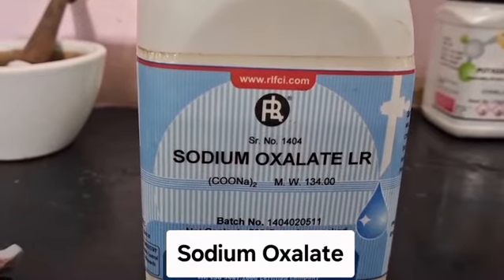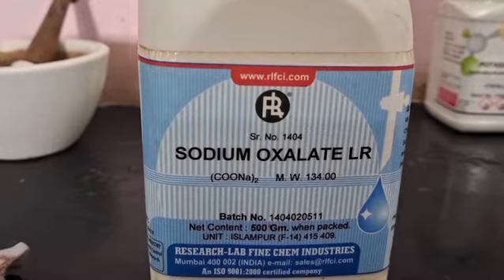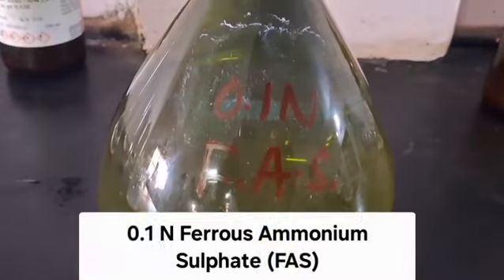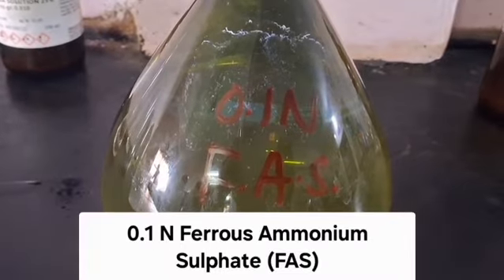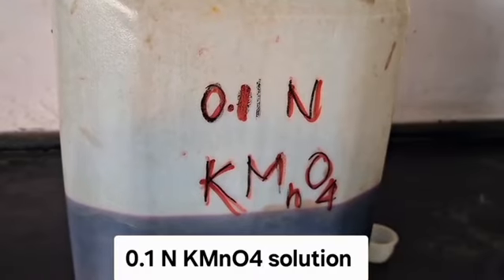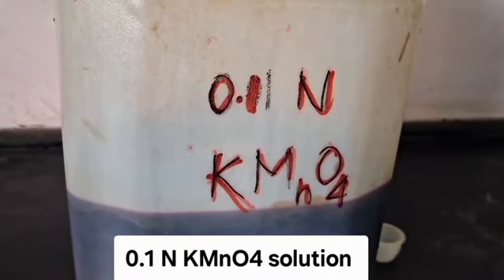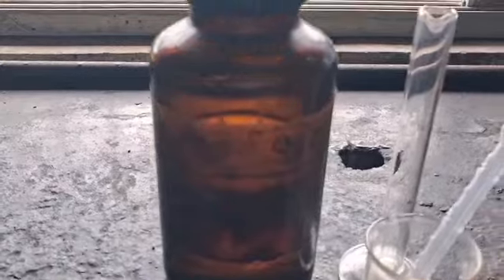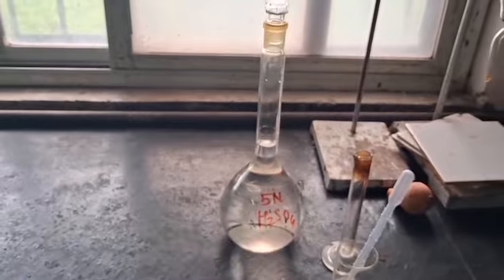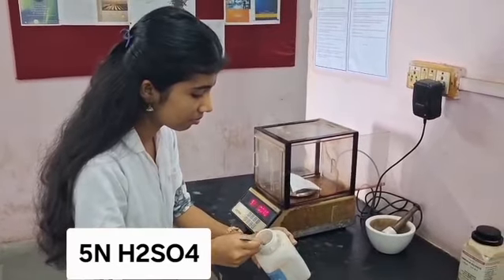For this experiment, we require sodium oxalate for the standardization of KMnO4 solution, 0.1 normal ferrous alum solution for the estimation of persulphate ion, 0.1 normal KMnO4 solution for the estimation of ferrous alum solution, phosphoric acid, 5 normal H2SO4.